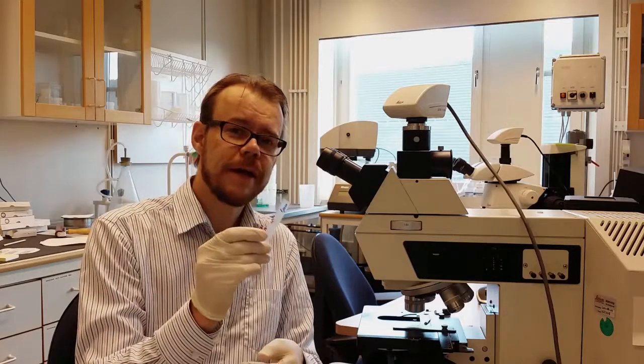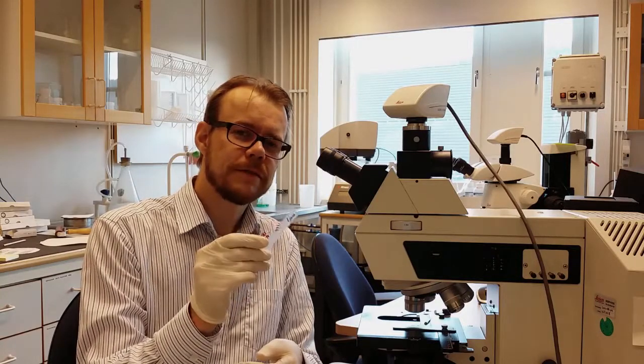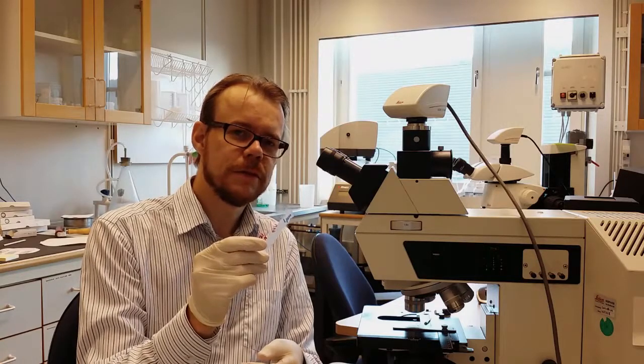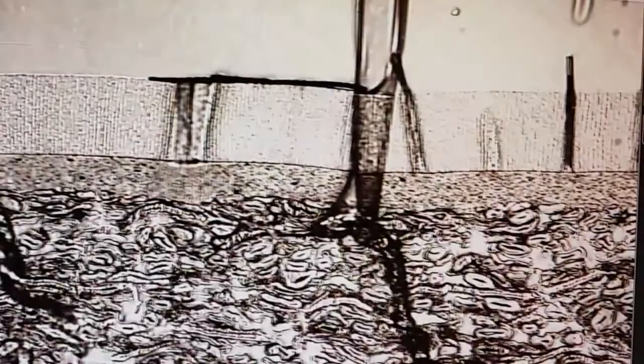So here I have another microtome slice paper. This paper has a top coating of plastic that will look very neat with the lambda contrast. We'll try that. So now I switch to 200 times magnification. Now clearly you can see the printed ink, and beneath it the transparent coating layer.